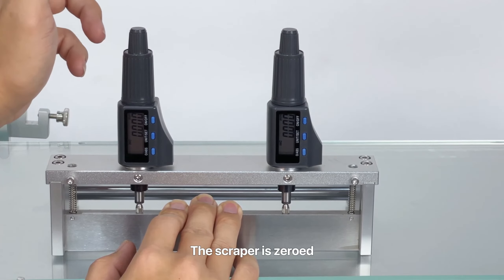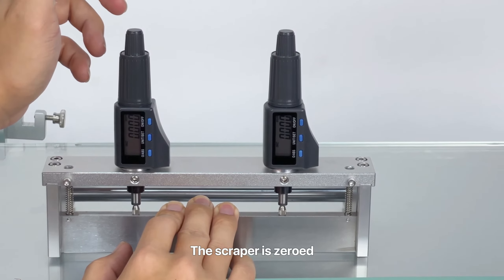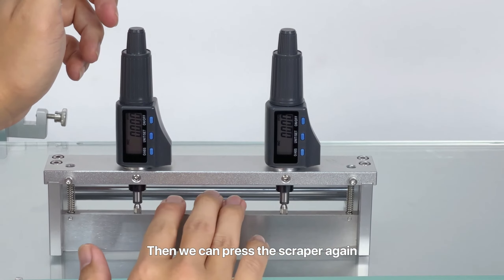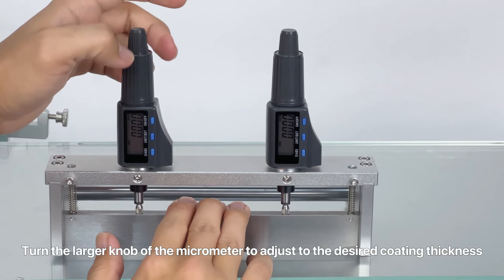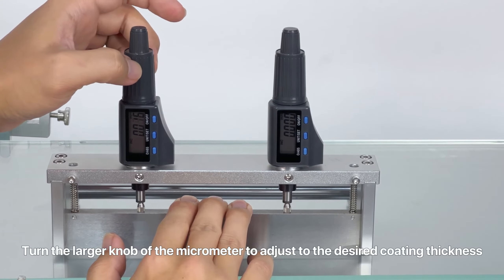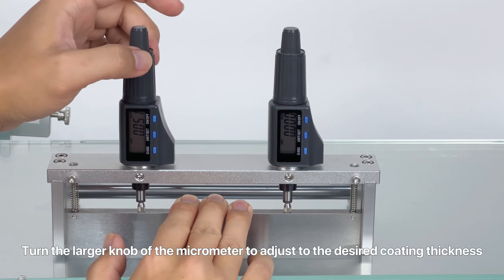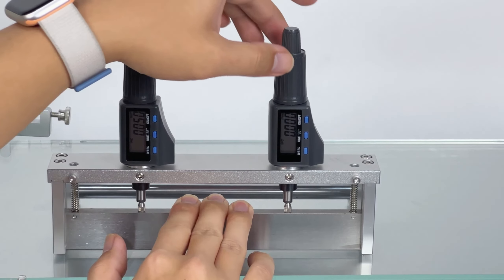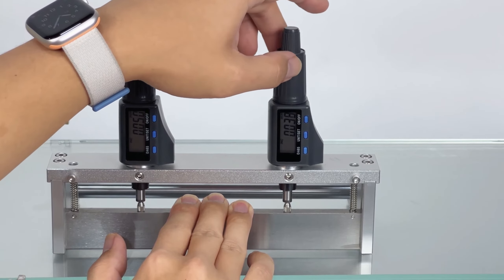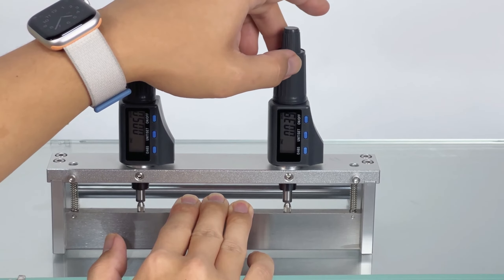The scraper is zeroed. Then press the scraper again and turn the larger knob of the micrometer to adjust to the desired coating thickness. After adjusting the required value, release the scraper.